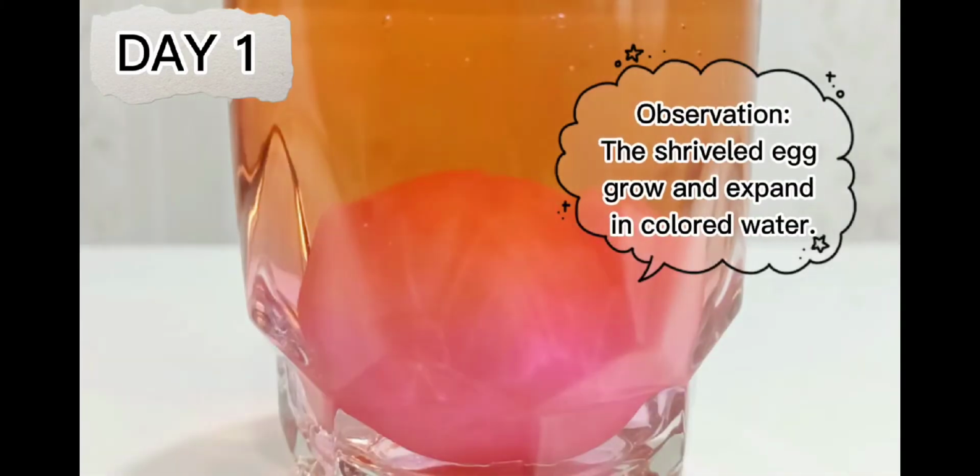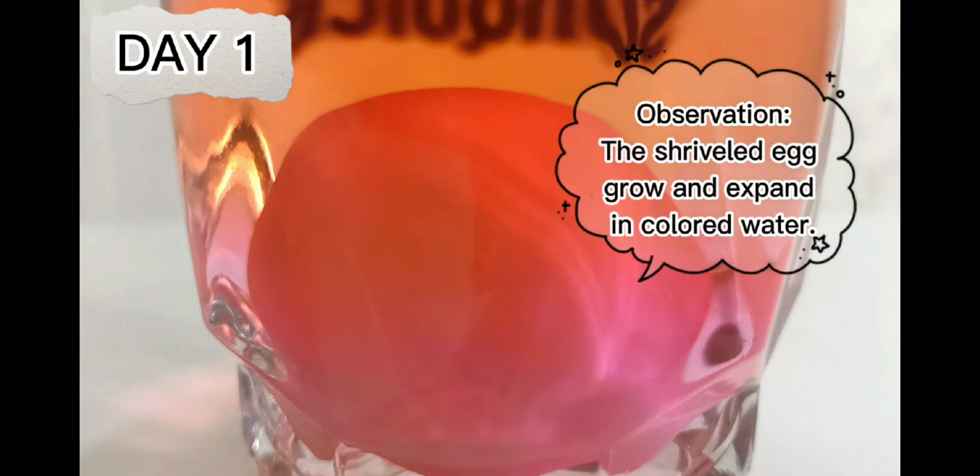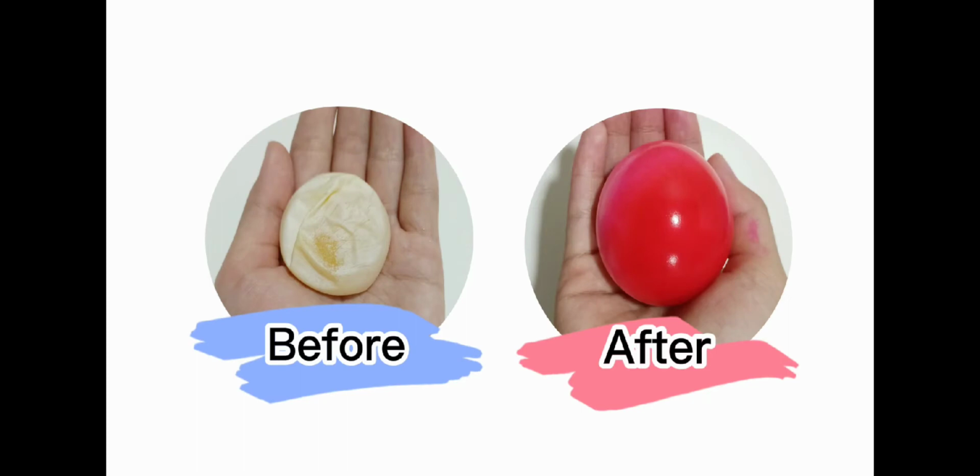The egg will begin to grow and expand as the water passes through the membrane into our egg. After 24 hours, pour out the water and gently catch your egg. From this, we could see that the shriveled egg grew in size and expanded during the process.